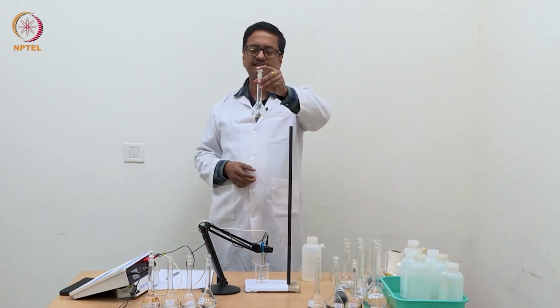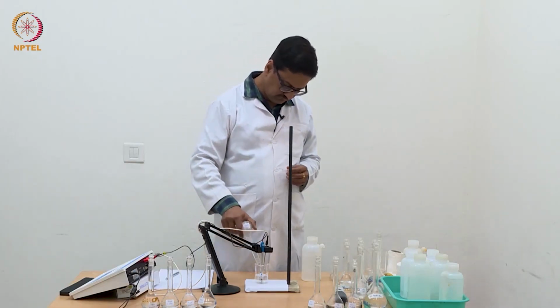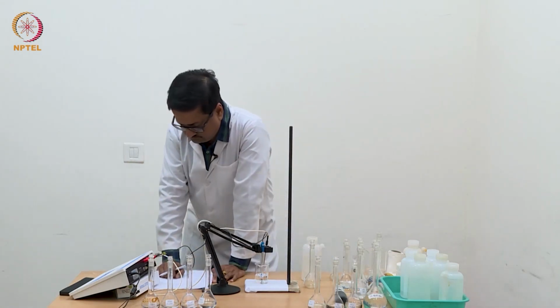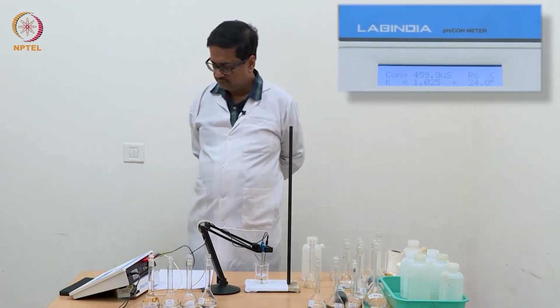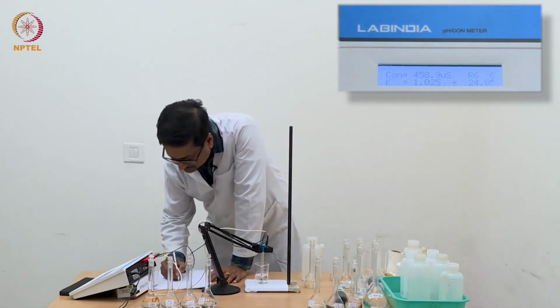Now I will use this N/16 acetic acid solution. So I am taking this reading as 458.9.